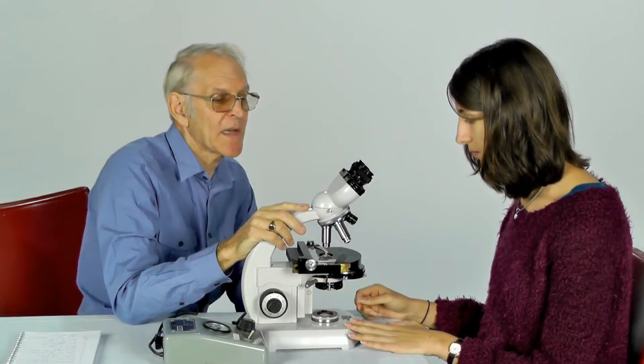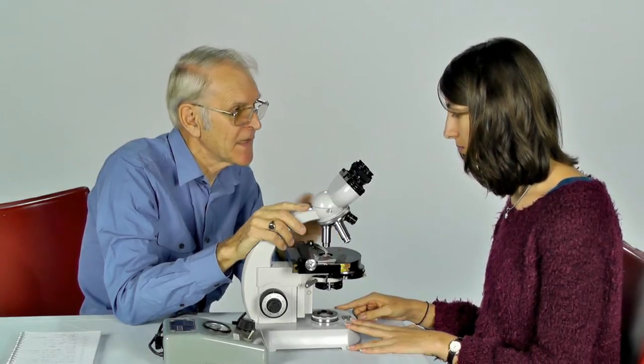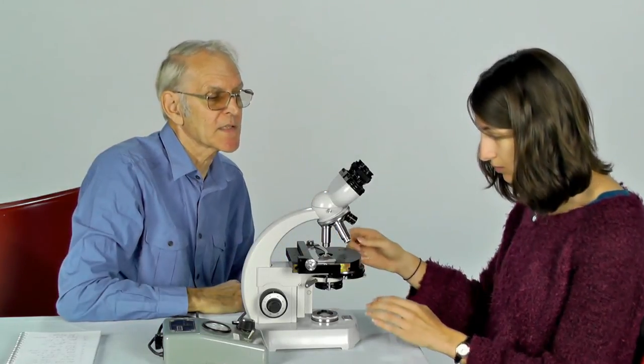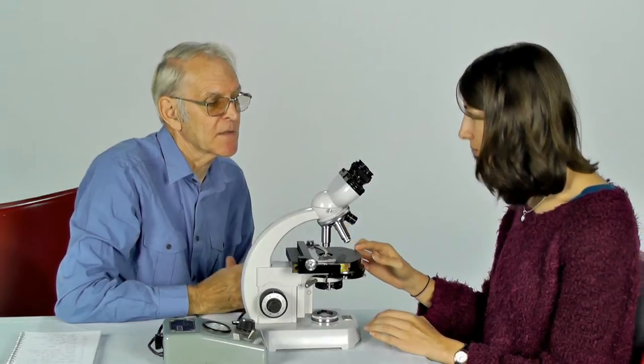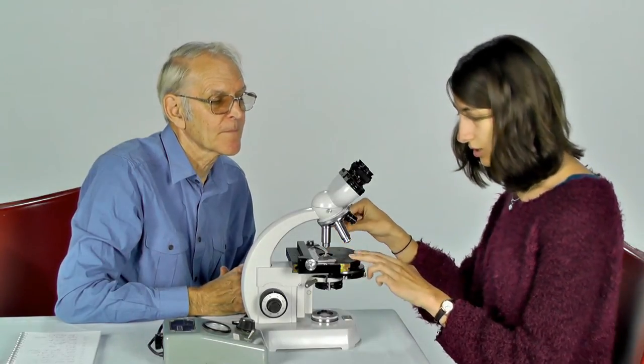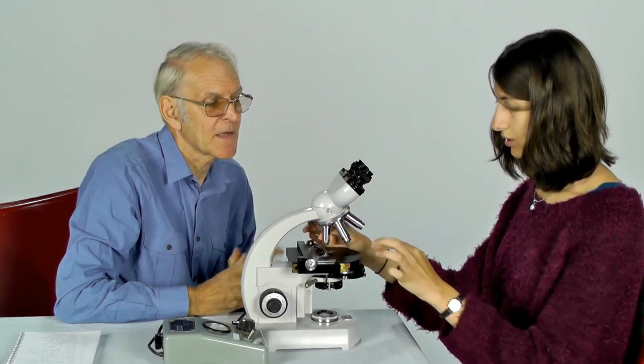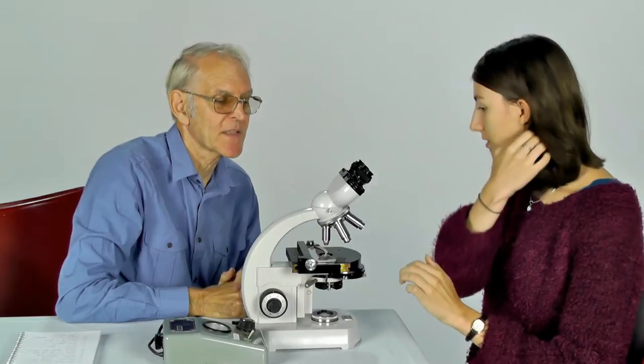Next we need to make sure that we have the correct objective lens in place. And we're going to use the times 10. Can you see there's one of the lenses with 10 written on it? Yep. That's got 10. You heard it click into place. Yes. That's good.